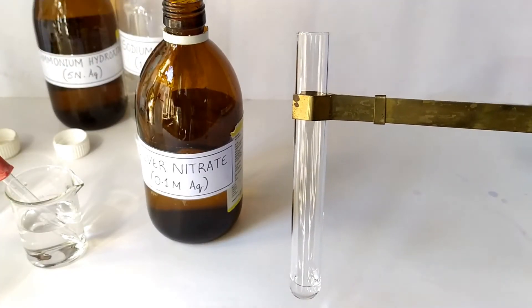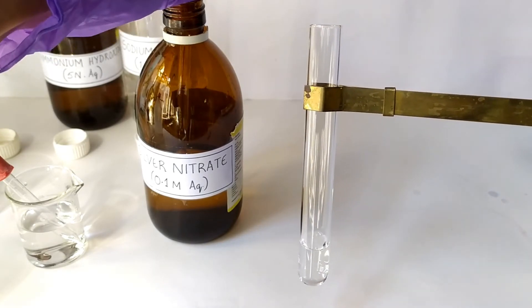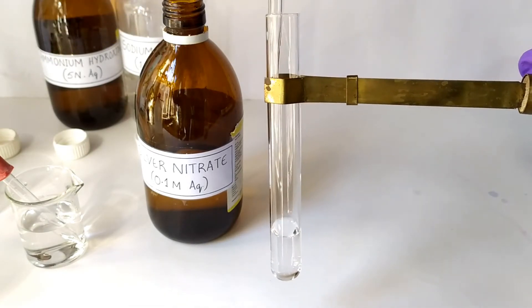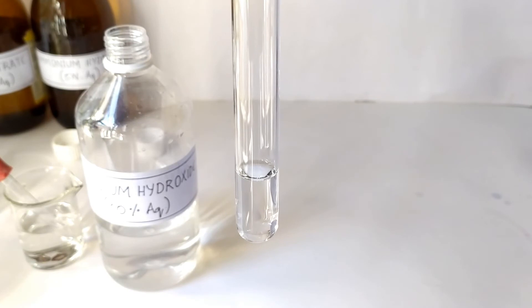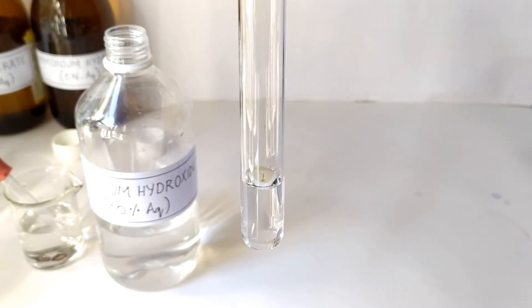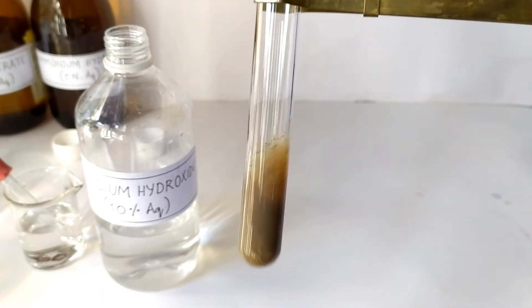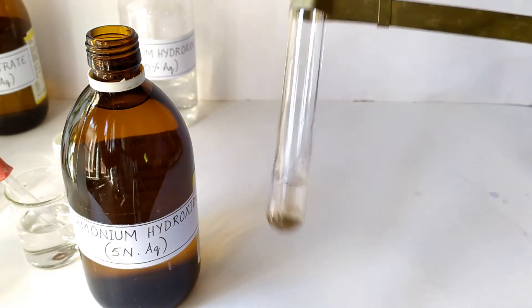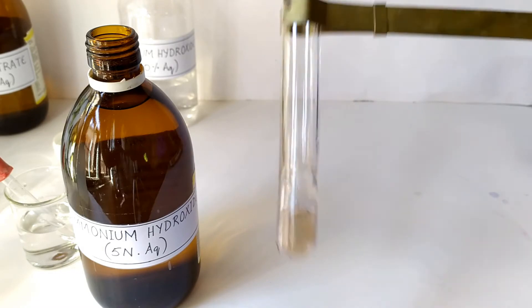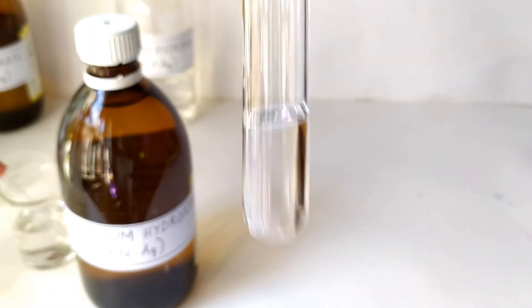We begin the experiment by first preparing fresh Tollens reagent. Take about 5 ml of 0.1 molar silver nitrate in a test tube. Add sodium hydroxide solution drop-wise until a light brown precipitate — silver oxide — is formed. Then add ammonium hydroxide solution drop-wise until the precipitate dissolves completely. Tollens reagent is now prepared and ready to be used.